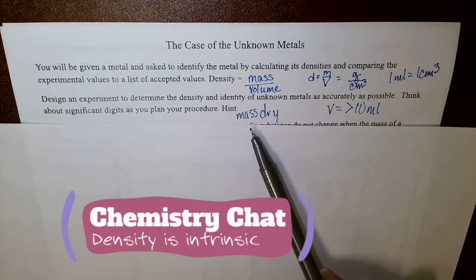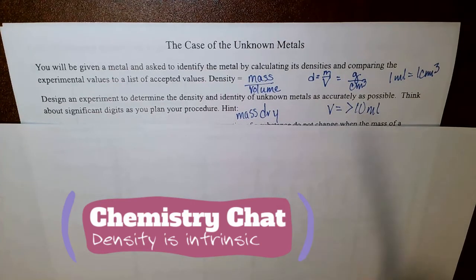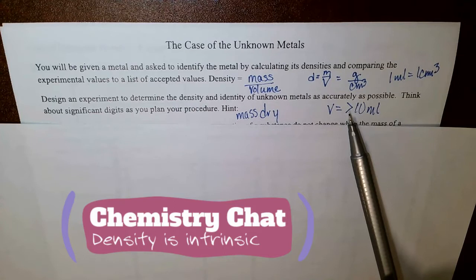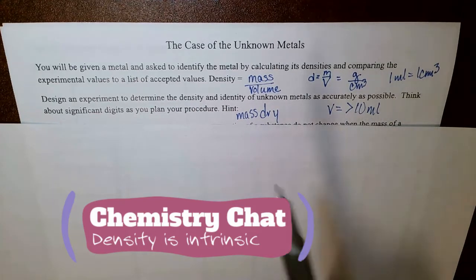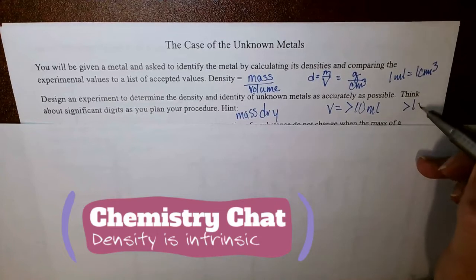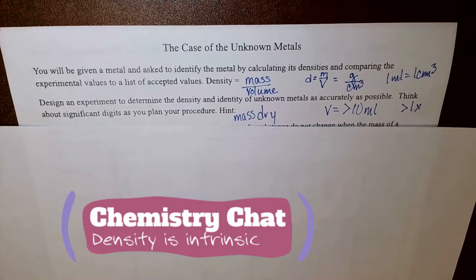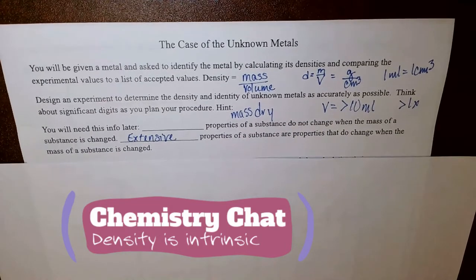I do recommend that you mass while the metal is dry, so before it gets wet. And when you're measuring the volume, try to get greater than 10 milliliters of the metal when you find the mass. You're also welcome to do this more than 1 time. Multiple trials may be helpful here. And you will need this information later.